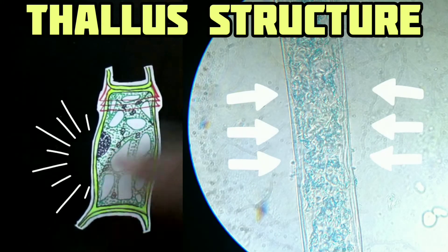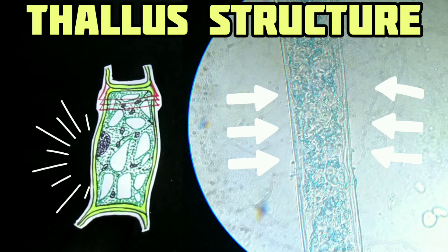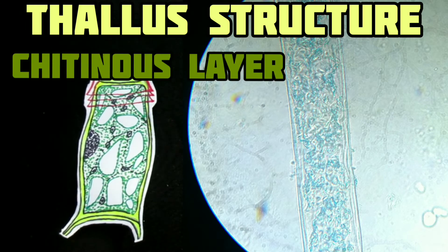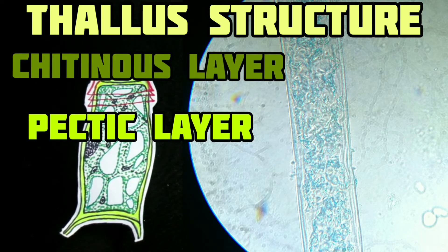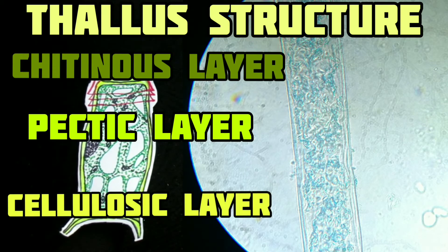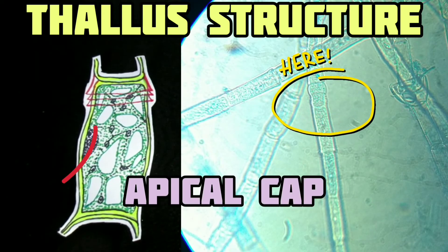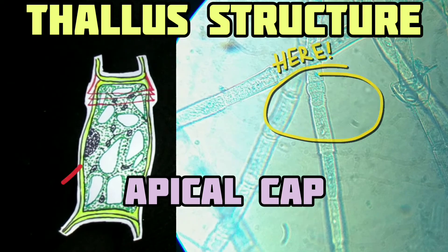The distal, that is apical, cell is generally broadly rounded or acuminate. The vegetative cells are provided with a thick rigid wall. The lateral wall of such a cell is composed of three layers: an outermost chitinous layer, a middle pectic layer, and an inner cellulosic layer. Lateral walls of some cells of each filament have one or more ring-like markings at the distal end, which are called caps or apical caps.